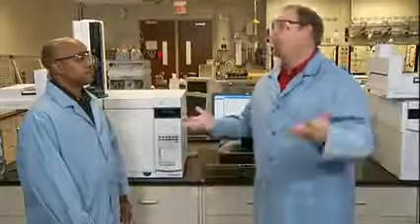When it comes to the liner selection, there's actually quite a lot to consider: deactivation, glass wool, how much glass wool is used, the volume of the liner, the tapers, top or bottom, thermal mass considerations, and how that affects volume. That sounds like a lot to cover. Can we go back to our ghost peak issue now? Yeah, sorry. Liner selection is a huge topic for another discussion. Let's get back to ghost peaks.